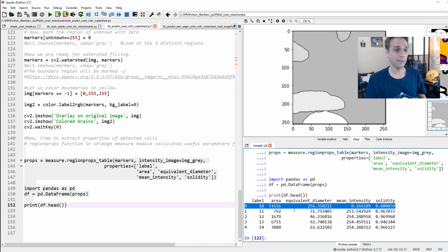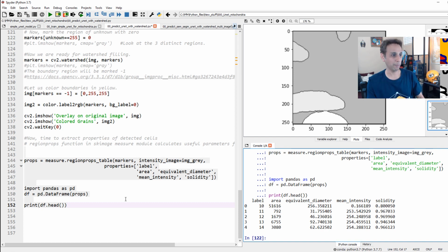You see how label number 0 seems to be the background. It's actually identifying this as another object, but for the true objects I'll have to go back and check. This is easy because I know my objects have a diameter of some specific range, and if something is 256, then that is too big, right? I can filter these out later in my CSV file or in pandas.